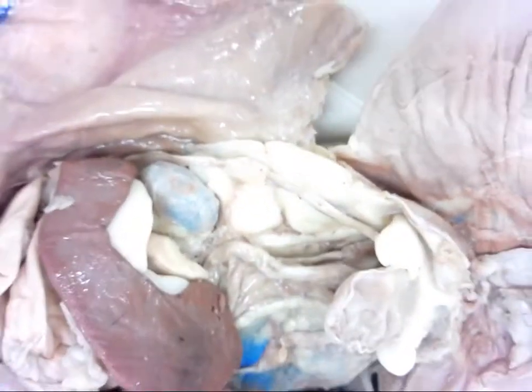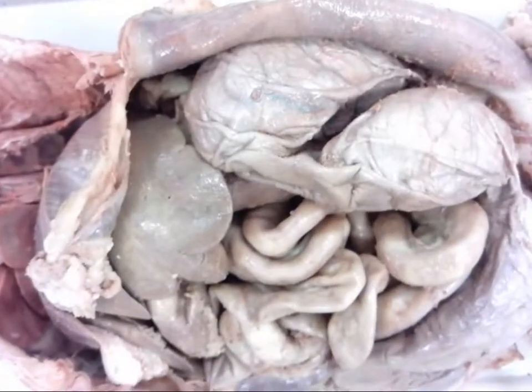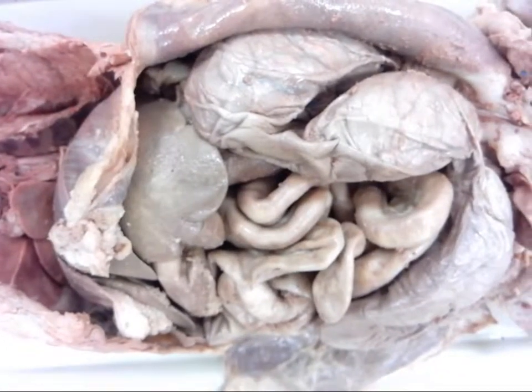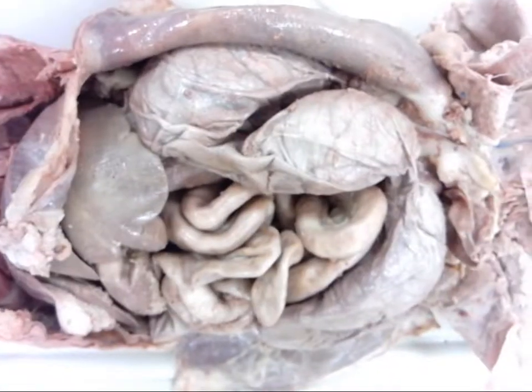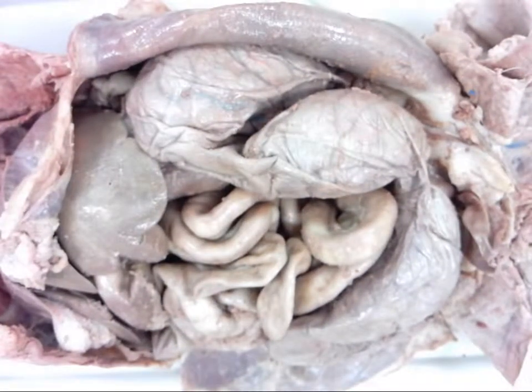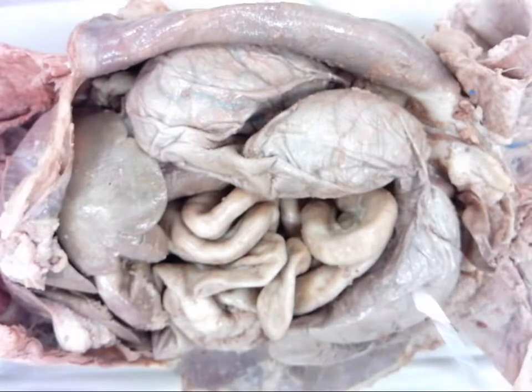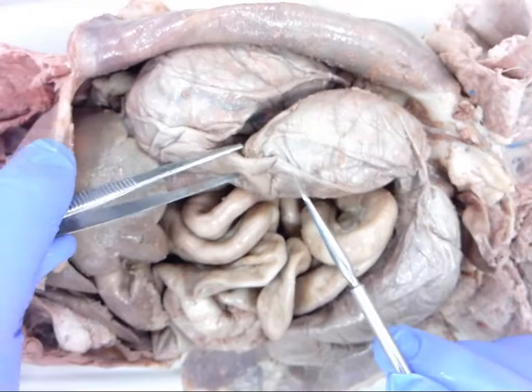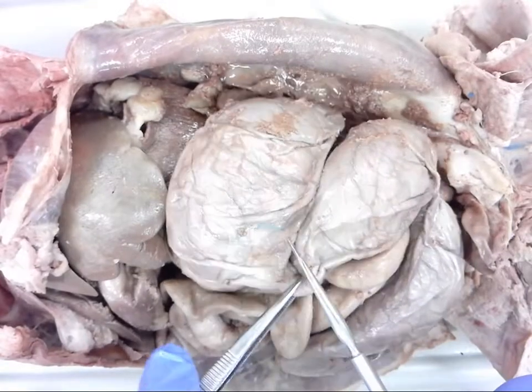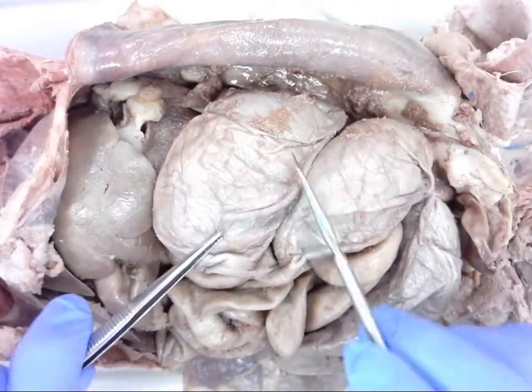Let's take a quick look - I'm going to move over to another specimen here that is actually going to be pregnant. You'll see quite a bit of variation. This specimen is actually very pregnant, probably not too far away from giving birth. What we'll see here is the uterine horns - if you refer back to that last picture, you can see how big they are.